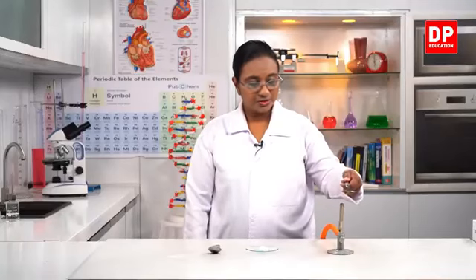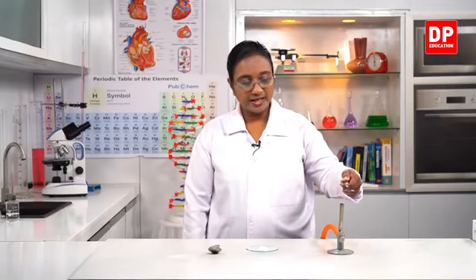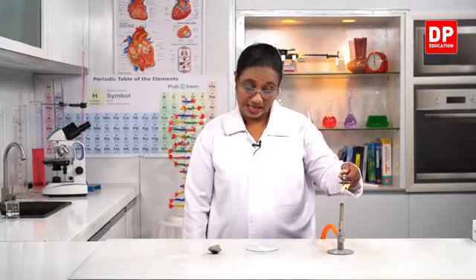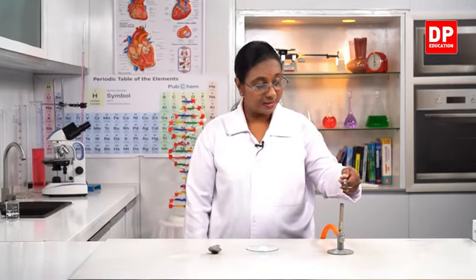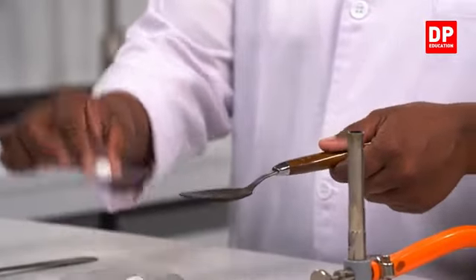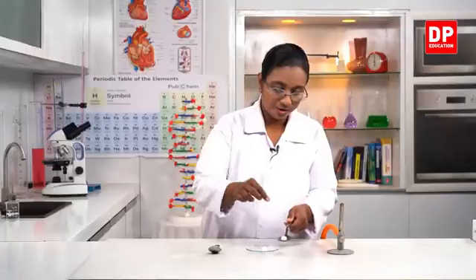So students, it should be enough heating of the metal spoon, so I can take it off, and before I put the mothball, I'll make sure that I turn off the Bunsen burner. There is a chance that the mothball can catch fire. So to prevent that, it's better if you turn off the burner. Okay. So now students, it's a hot spoon. I'm going to put the naphthalene ball, mothball onto it.